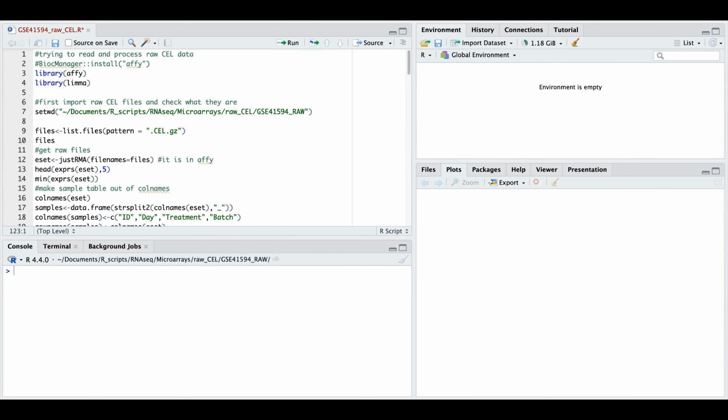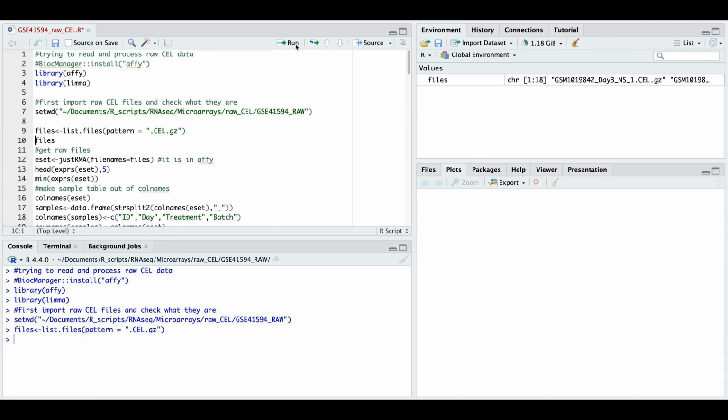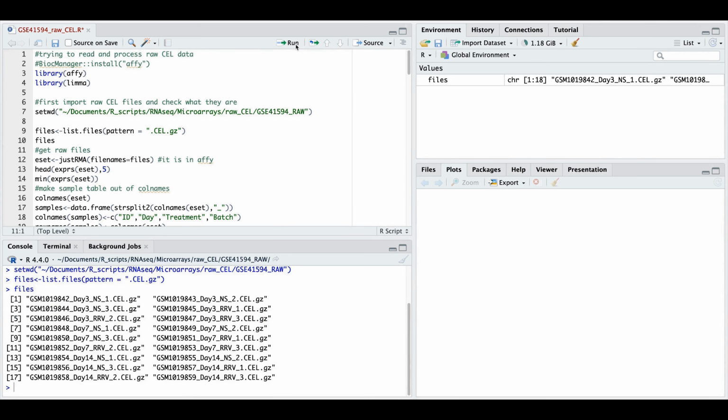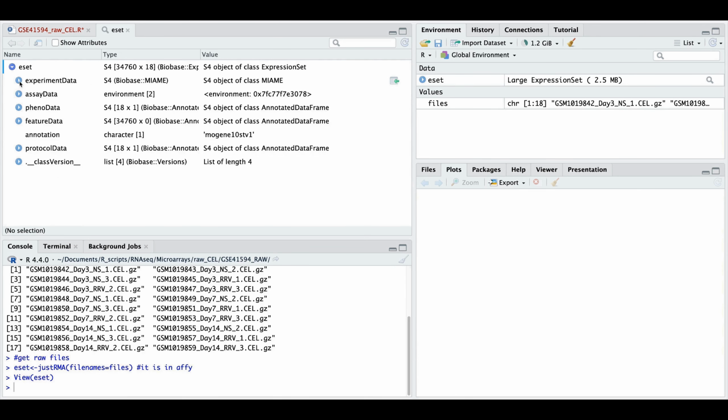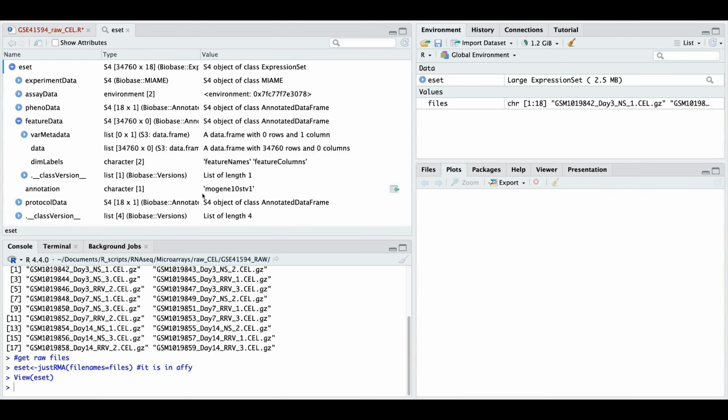Now we are ready to analyze the data. First we import affy and limma. Then of course you place your raw CEL files and list the files. Here we are. And now we use this famous justRMA function, where in one line we generate ESET. Structurally, ESET looks very much like GSET generated by the getGEO function. It also has assay data, phenodata, feature data, everything. Only for features it's not much.